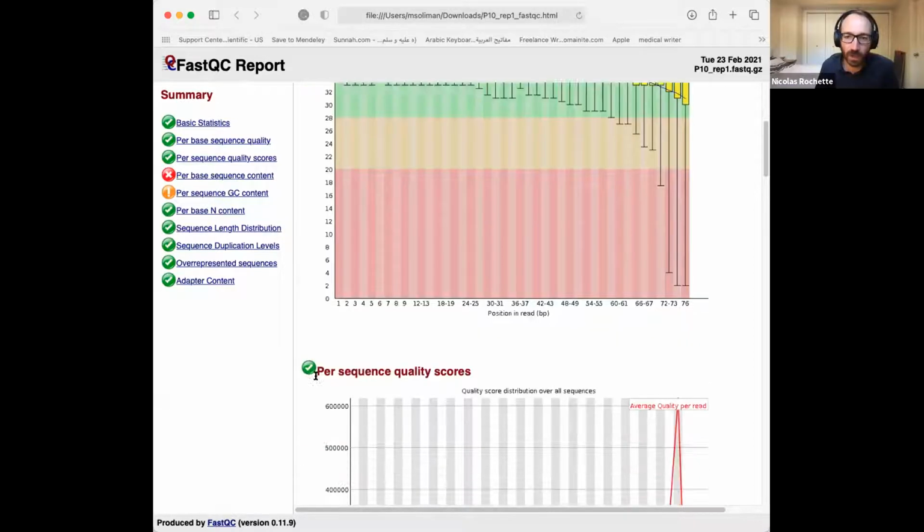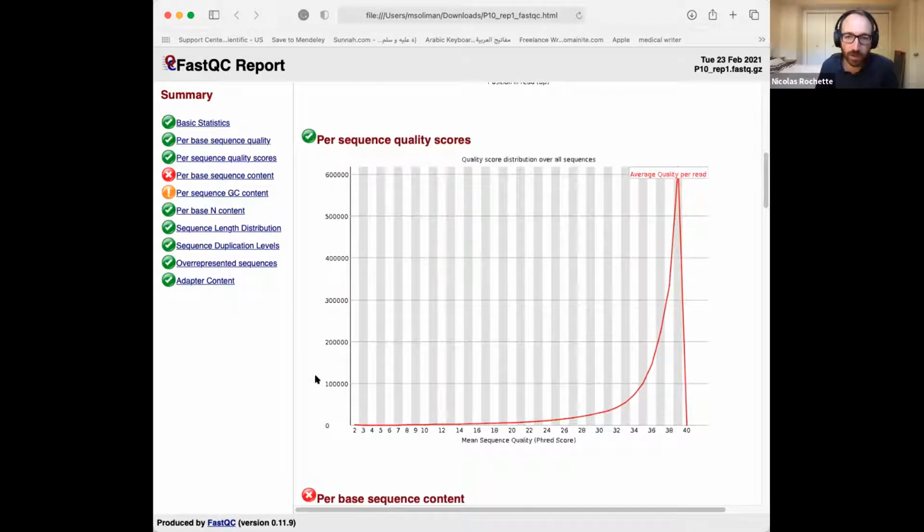The second one is just asking whether there is a subset of reads that have a lower quality, and this is a good result. Sometimes you see a bump in the middle, which may or may not be an issue. Sometimes it is just specific tiles of the flow cell, and in that case it's not a very big issue. Sometimes it can reveal an issue with a sample.